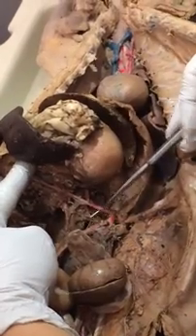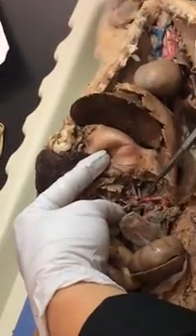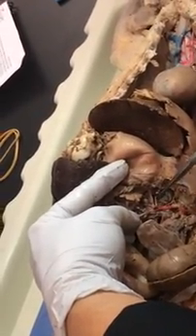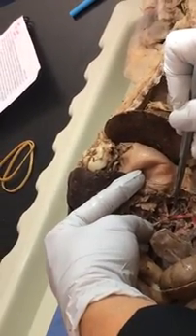Here's the celiac artery. And then I'm going to pull on it and see what I got. Oh, yeah. Okay, so here's the celiac. And on this cat, the phrenic comes off the celiac, going to the diaphragm. That's a nice phrenic. Okay, this first big one that dives deep is the hepatic artery.